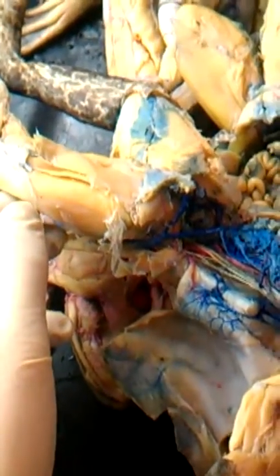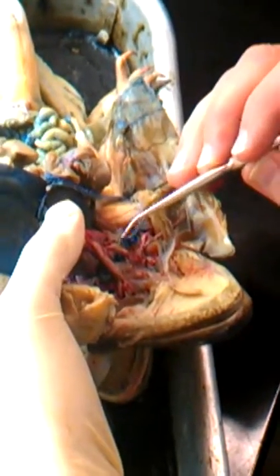Okay, veins that are on your list. You got the anterior vena cava, which there are two of them, left and right. And they often don't inject real well, but we can see some of that on here. There's a lump right in here.